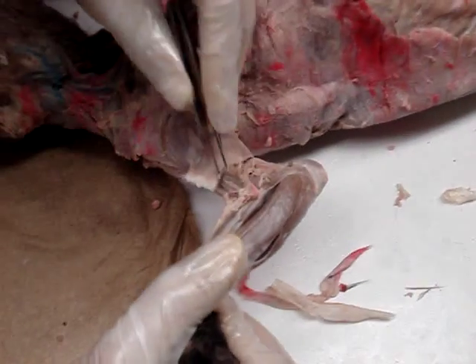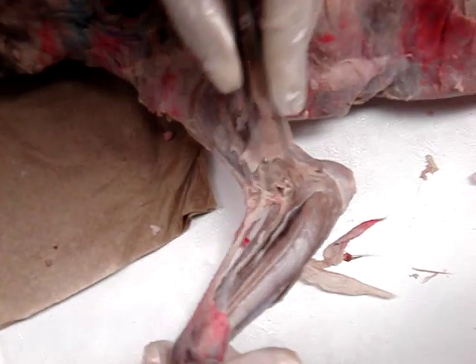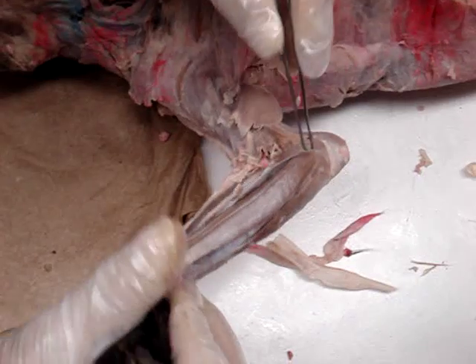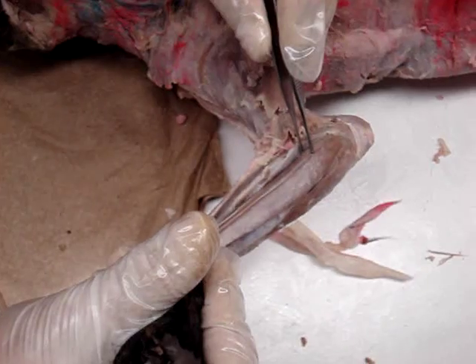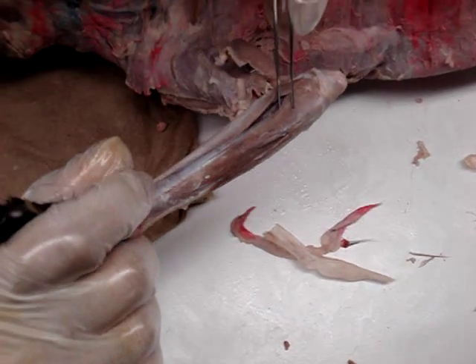On this side is easier. On this side is PFPF. So this is the pronator teres. You're going to have PFPF and you go back to the flexor. So: pronator teres, flexor carpi radialis, palmaris longus, flexor carpi ulnaris.